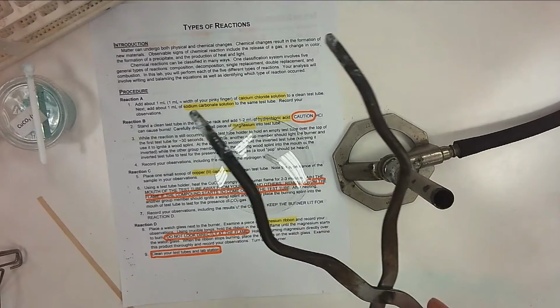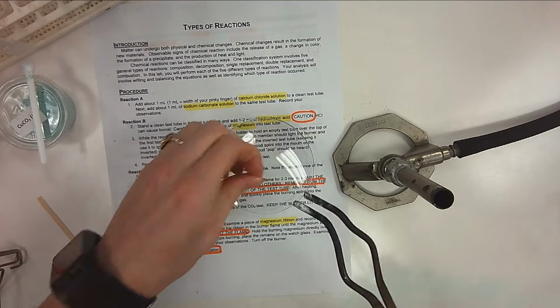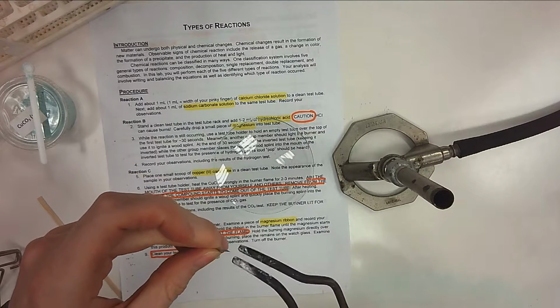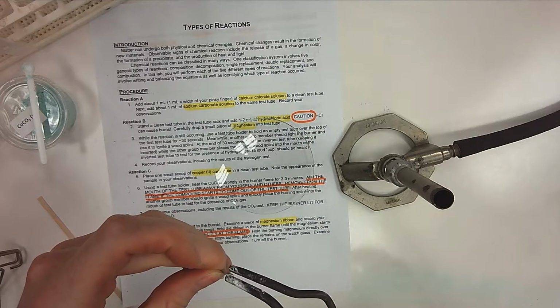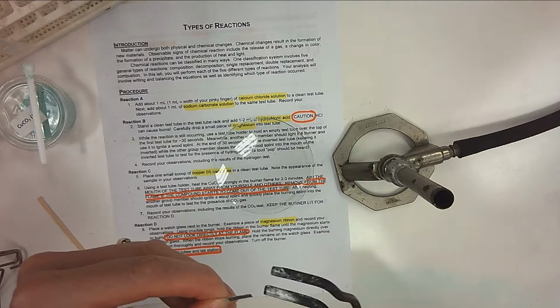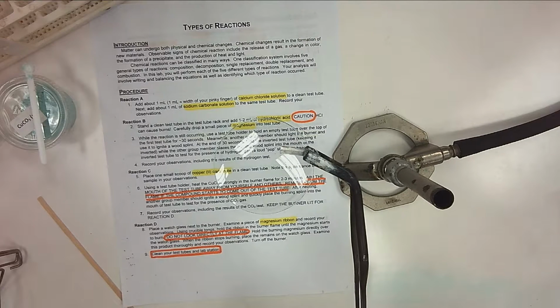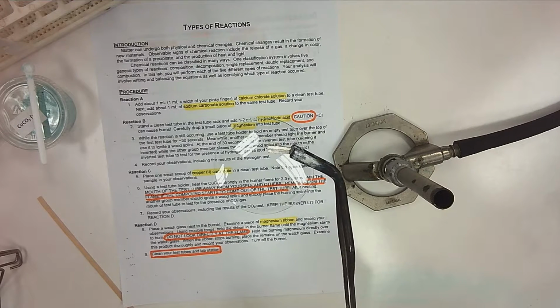Afterwards, you're going to take, these are crucible tongs. You can pick up the magnesium ribbon too, it's okay. All right, and what I'd like you to do is just secure the end of it. So you don't need to have the whole thing covered with your crucible tongs. Just have it securely enough to where you at least have a piece of it, holding tightly on the end.